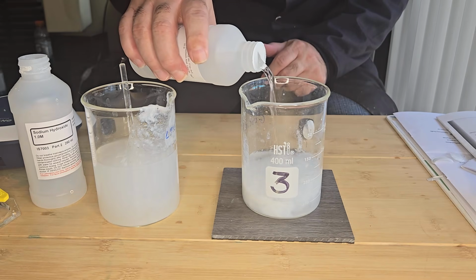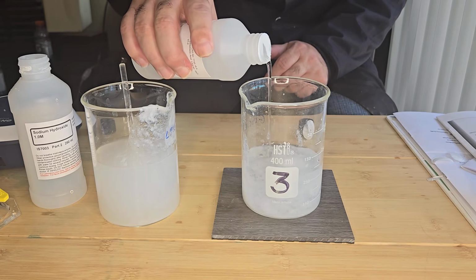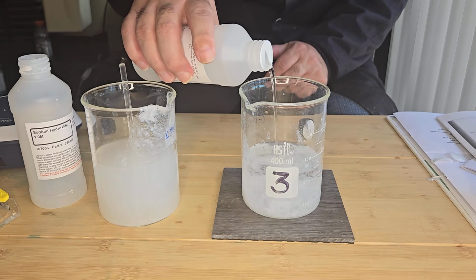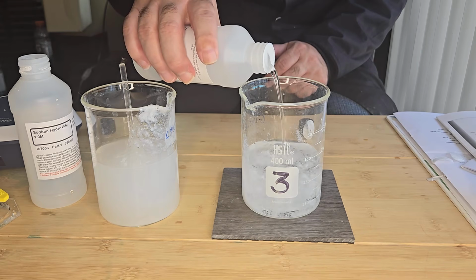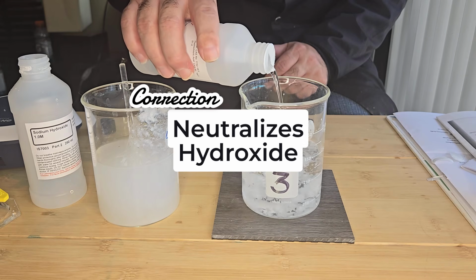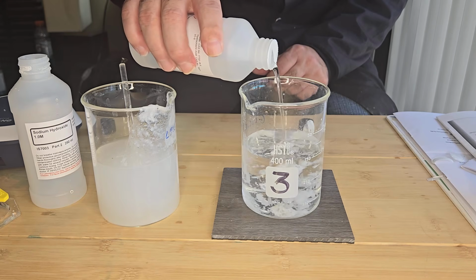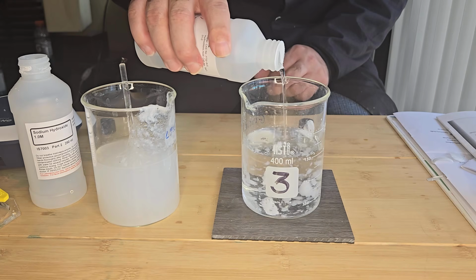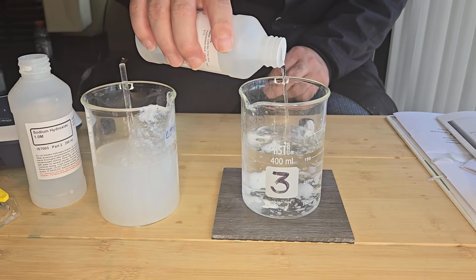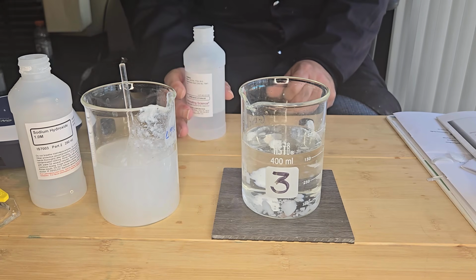The precipitate crashes out of solution. The acid neutralizes the hydroxide, and zinc is present as zinc hydroxide. You can see the white precipitate with enough hydrochloric acid. So now you can see that zinc hydroxide precipitate.